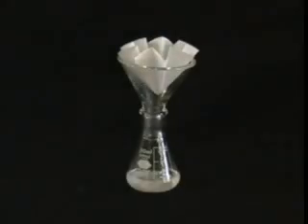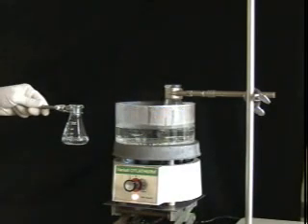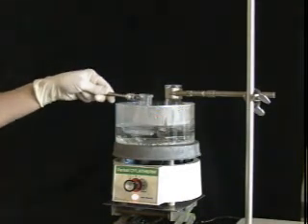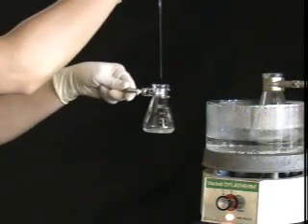Crystals frequently form in the filtrate during the filtration, but they easily re-dissolve with heating. CAUTION: Your compound is no longer dissolved in a minimum amount of solvent. Before proceeding to the next step, you need to boil away the excess solvent. Remember to add a few boiling stones to the solution and boil until solid begins to form. At this point, add a small amount of hot solvent to re-dissolve the solid. When your sample is once again dissolved in the minimum amount of solvent, set it aside to cool.